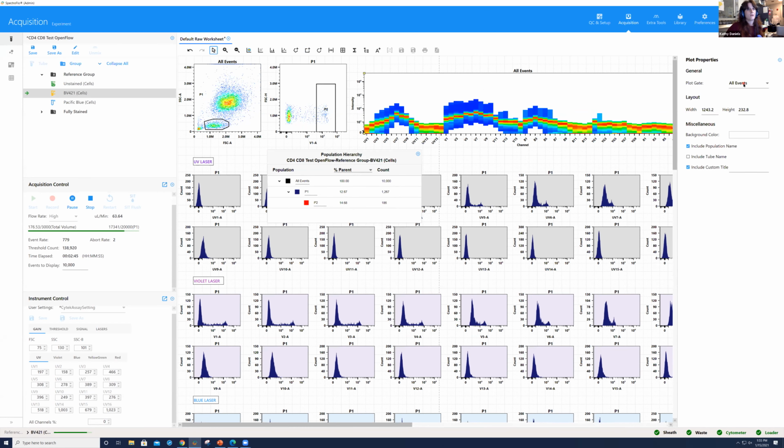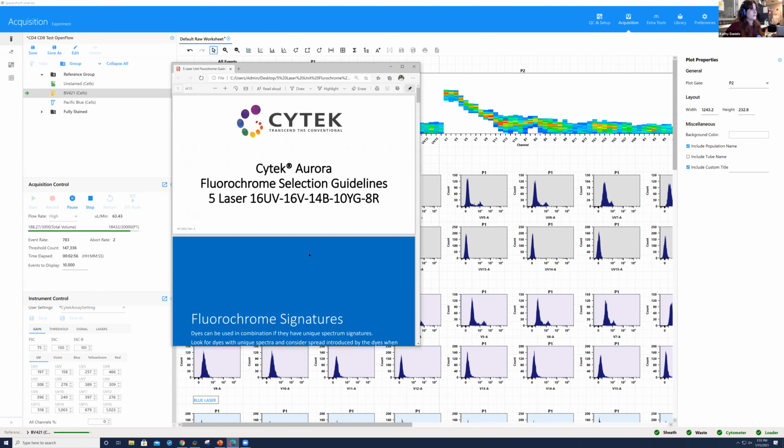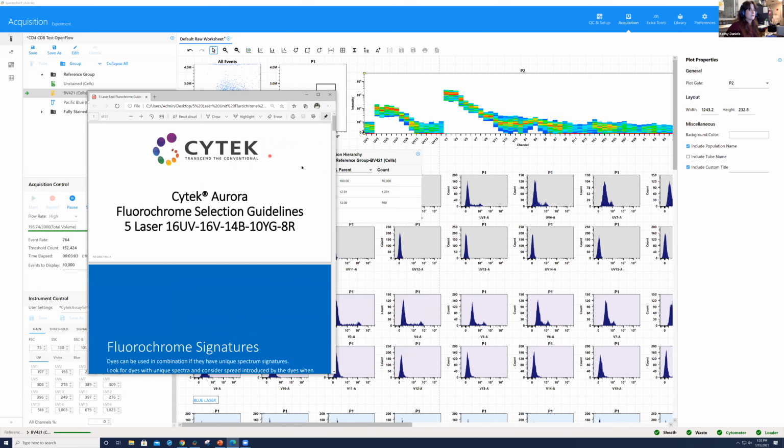Now here, as opposed to all events, if I choose P2, we can see the signature of BV421. Okay. Now, there's a document that's going to be available by Cytek. They have it on their website. And we always train people here in this facility as you're running your single colors to check this.